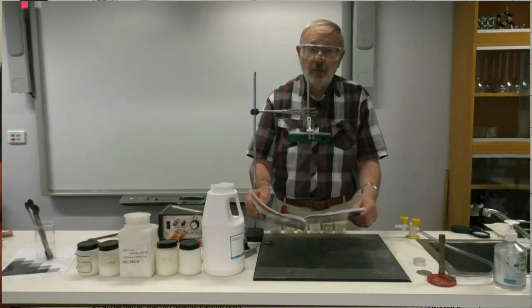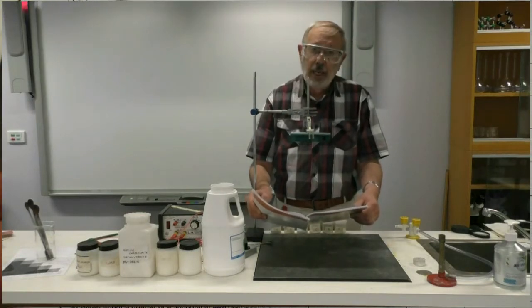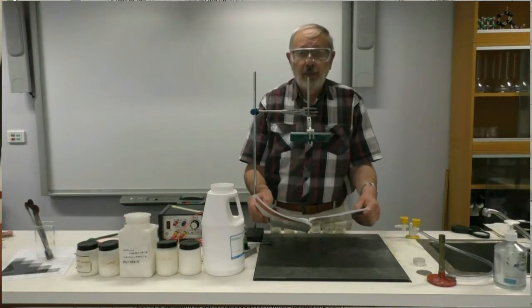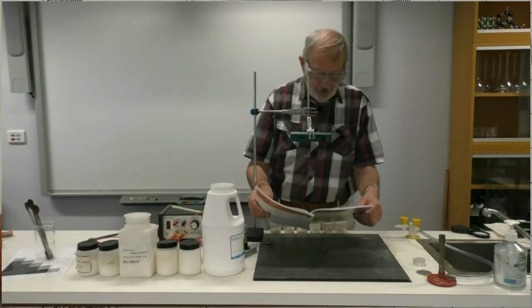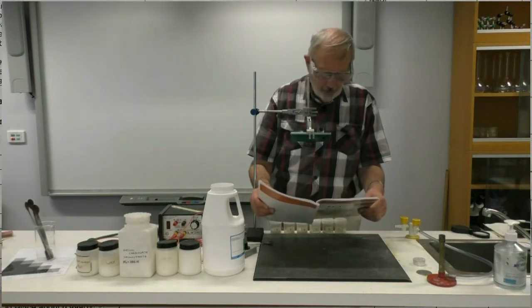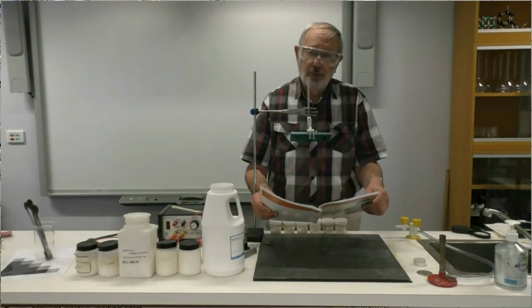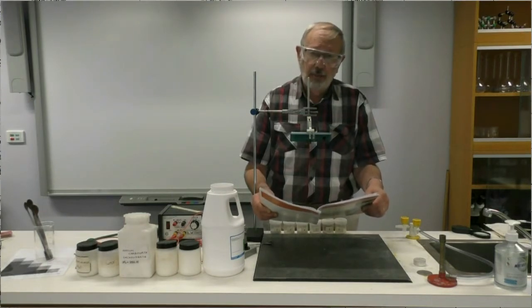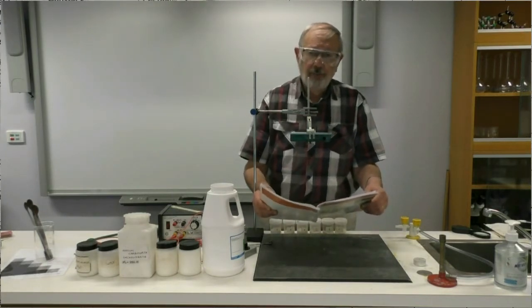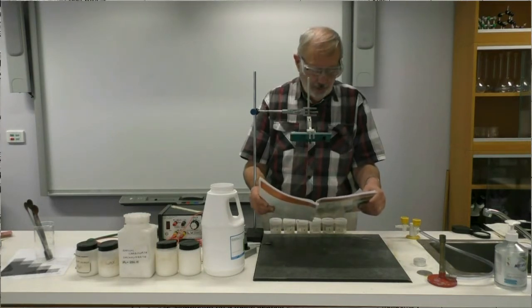Now the next thing for us to look at is its behaviour on strong heating. What we've actually done so far is really answered that question. So the question there, is there smoke or a change in colour? If we go back to those situations in which we put the substance into a Bunsen flame, then you can see the behaviour on strong heating.